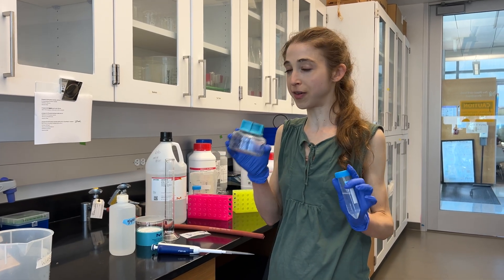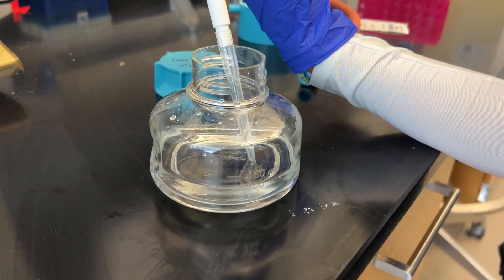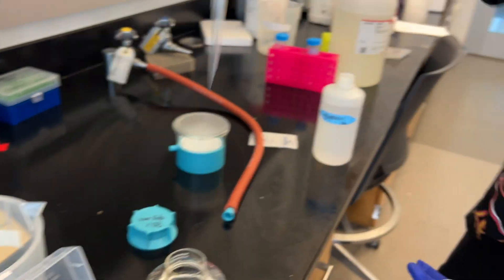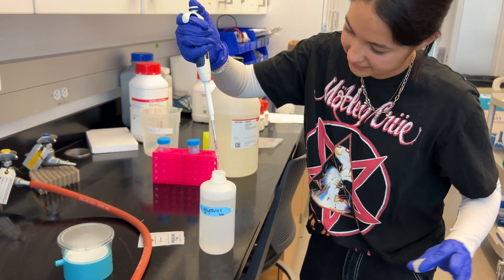I'm going to introduce you to one of my favorite lab tips: 80% glycerol. It pipettes almost like water, as opposed to if you try to pipette just pure glycerol — it is a thick, lumpy mess. 80% glycerol, though, is a totally different story.